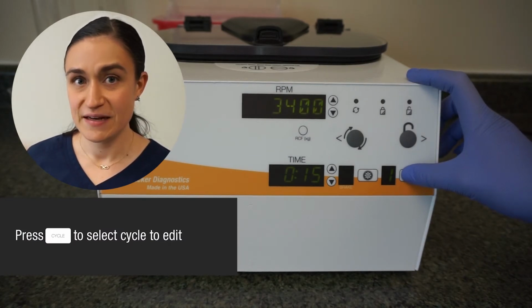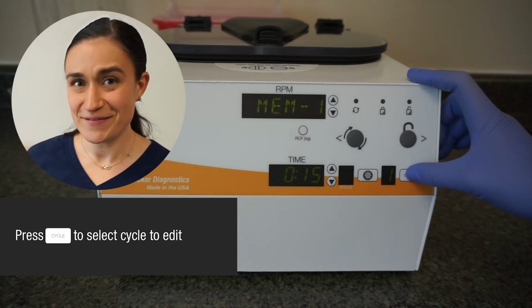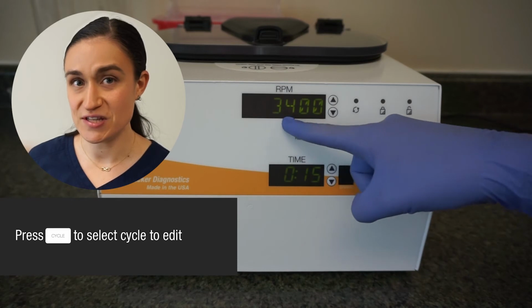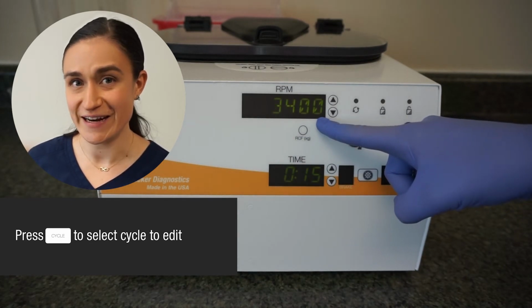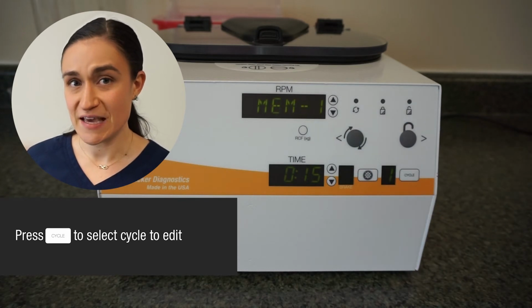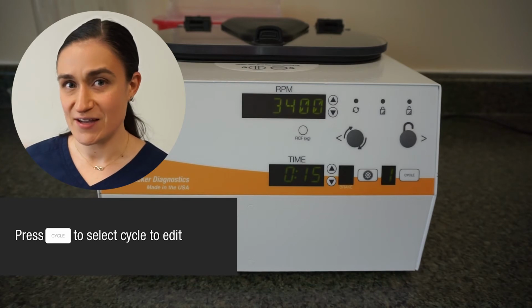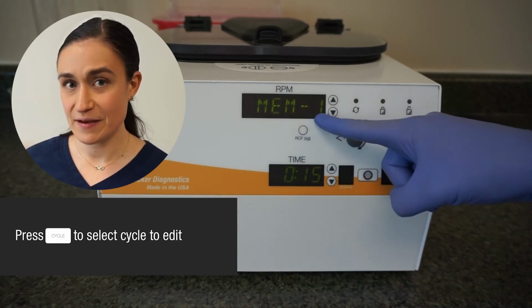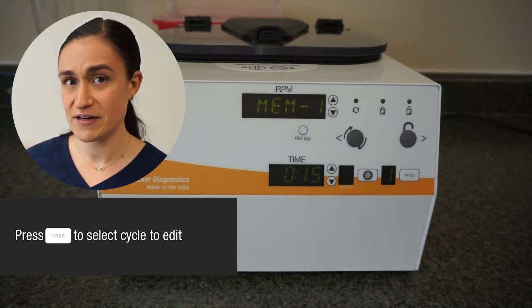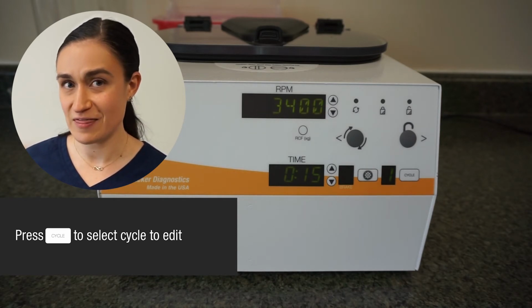We're going to start by using the cycle button to navigate to the saved cycle we want to edit. Now keep in mind, as we navigate between our saved cycles, the name of our currently selected cycle shows in the RPM screen, alternating with the RPM for that cycle. So in this case, we want to change MEM1. So we're going to navigate and make sure that that shows up in our RPM screen. And remember, we're changing from 3,400 to 3,500 RPM. So we're alternating in that screen between that 3,400 RPM that we currently have and that MEM1.